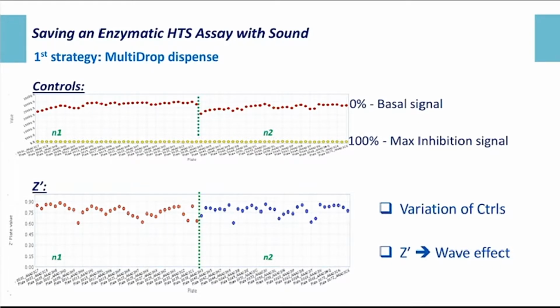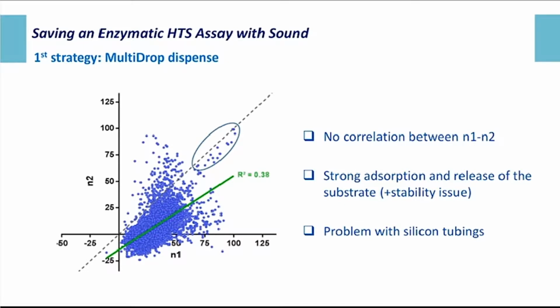Now if we look at the correlation between the 2 N, we can easily see there is no correlation between N1 and N2, even if some very potent compounds seem to correlate. We tried to explain those results, and especially the absence of correlation. It appears that we had some strong problems with the substrate. We had big problems of adsorption in the silicon tubing system, and also some problems of stability of the non-fluorescent form of the substrate, which is able to cleave by itself.